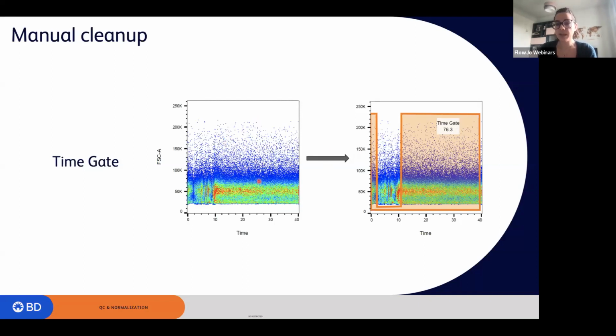If I need to make a gate, I will try to keep as many events as possible and then exclude the interval of time where something was wrong. So the time gate will just take all the good events, or all the events that I think could be reliable. And this is the default way within FlowJo of checking the quality.